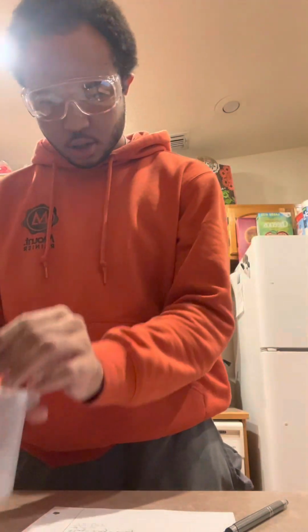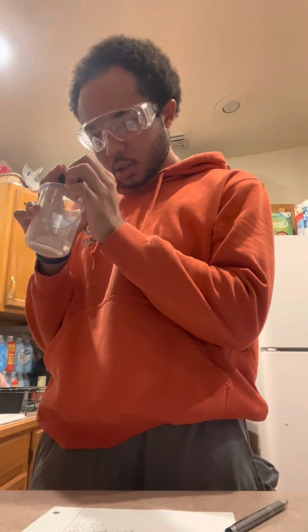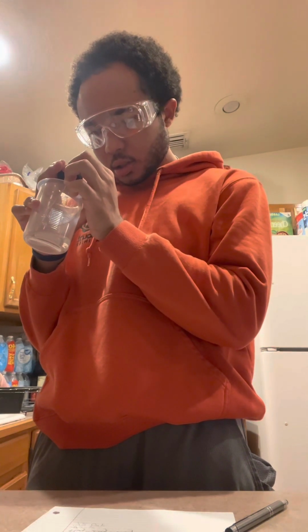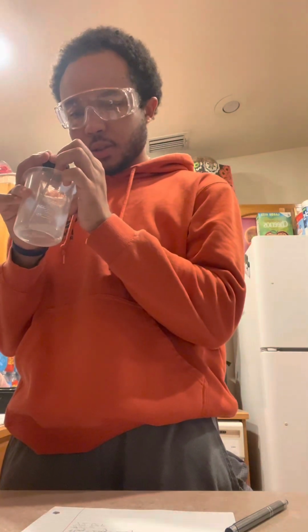Okay. So it's looking about, so this one goes up by 20, but each individual tick is about 2. Yep, 2. So since the 2s are known, it would be point something, because that's our unknown.